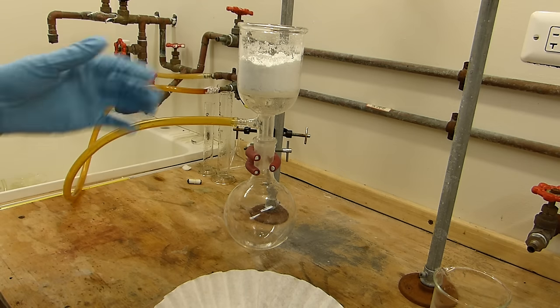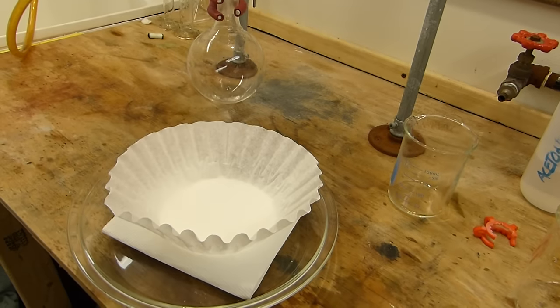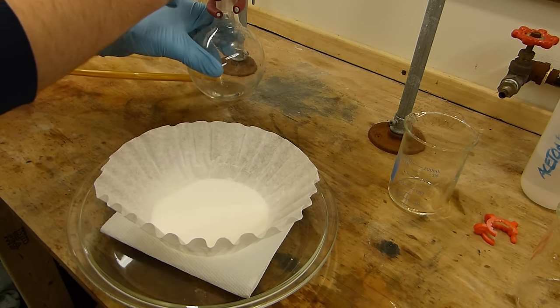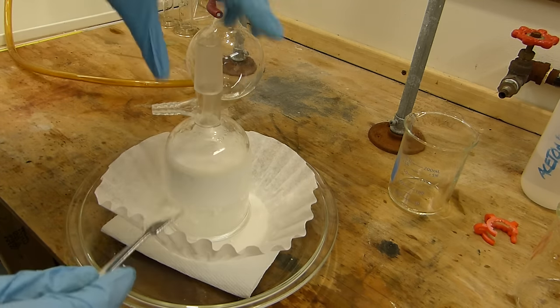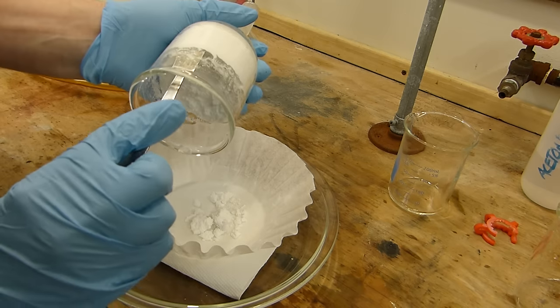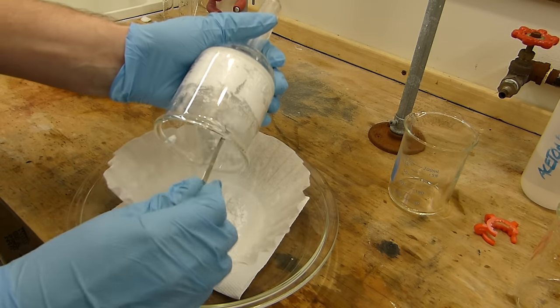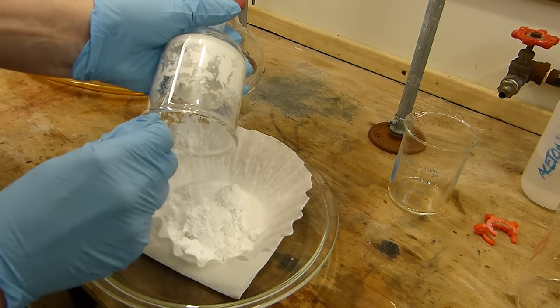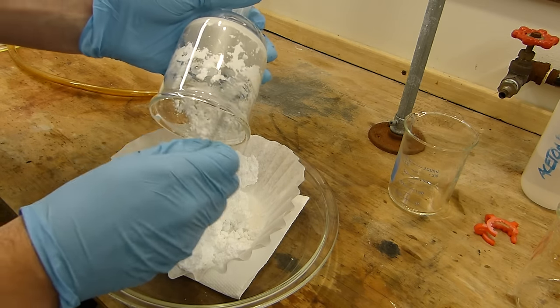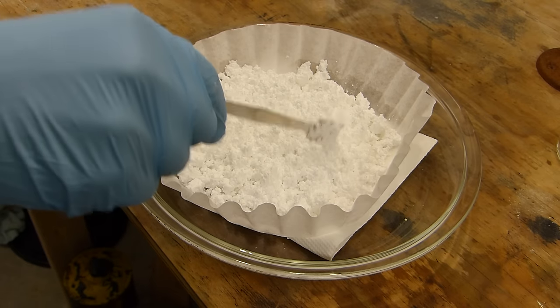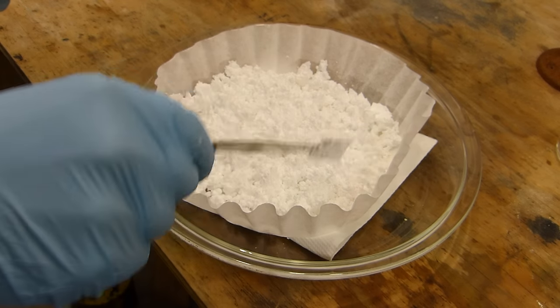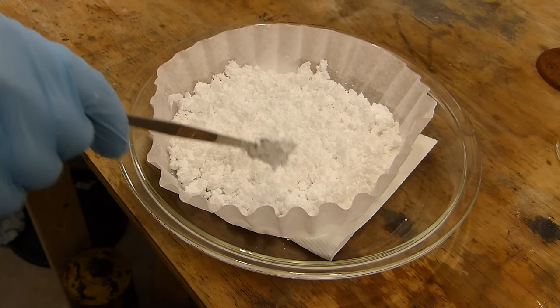With the vacuum filtration complete, I'll now empty the benzoic acid onto a standard drying pan, which is just the old coffee filter on top of a whole bit of paper towel trick. So we'll pull this off and we'll just empty it out. That's not gonna work. It's crunchy. It feels almost like wet snow. Very, very interesting texture. And we'll just break up as many clumps as possible and spread this out as evenly as possible. Allow the paper towel to suck the water out of it and then we can change out the paper towel periodically to make sure that this dries nicely.